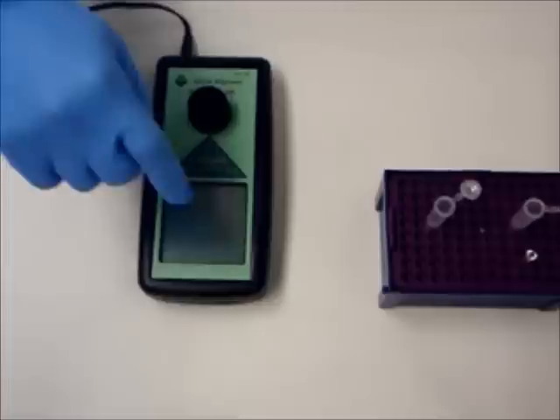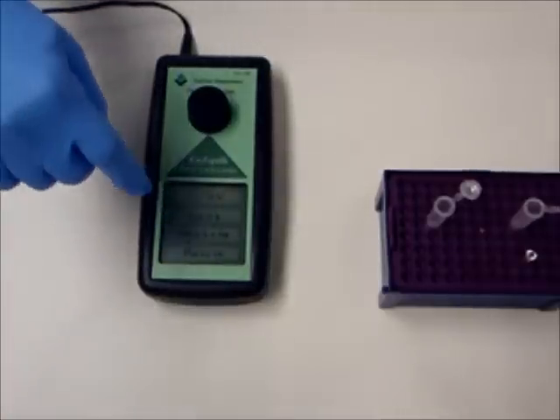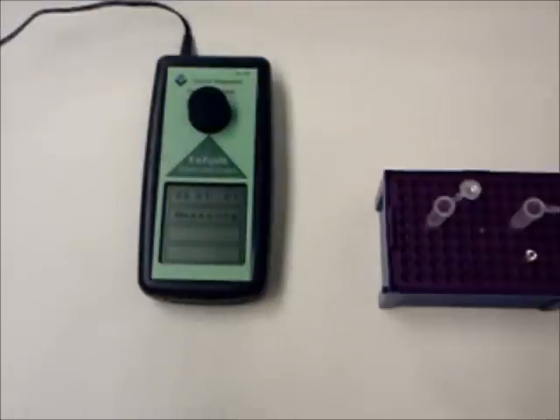Push the measure button at the top of the touch screen to enter the measure mode. Push the measure button on the touch screen and record the result of the control.